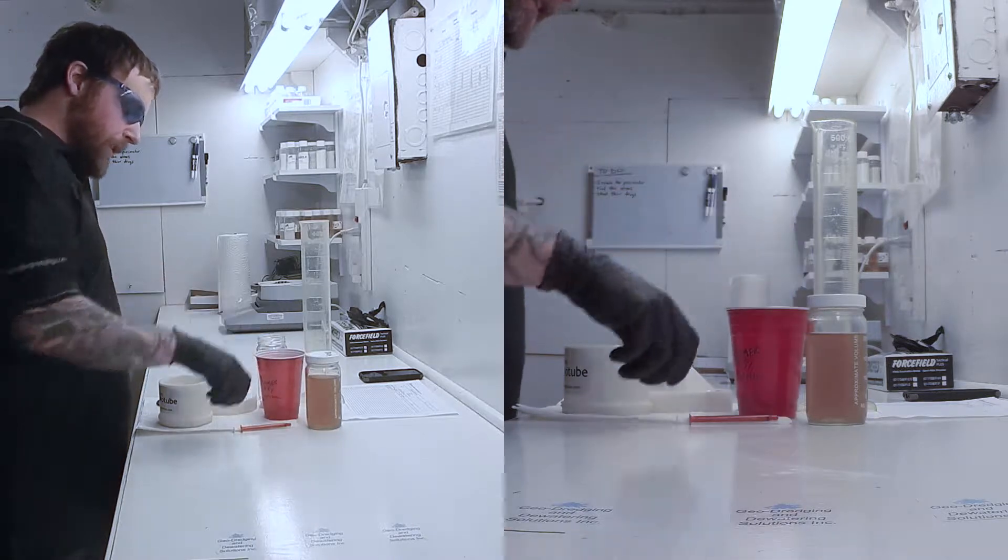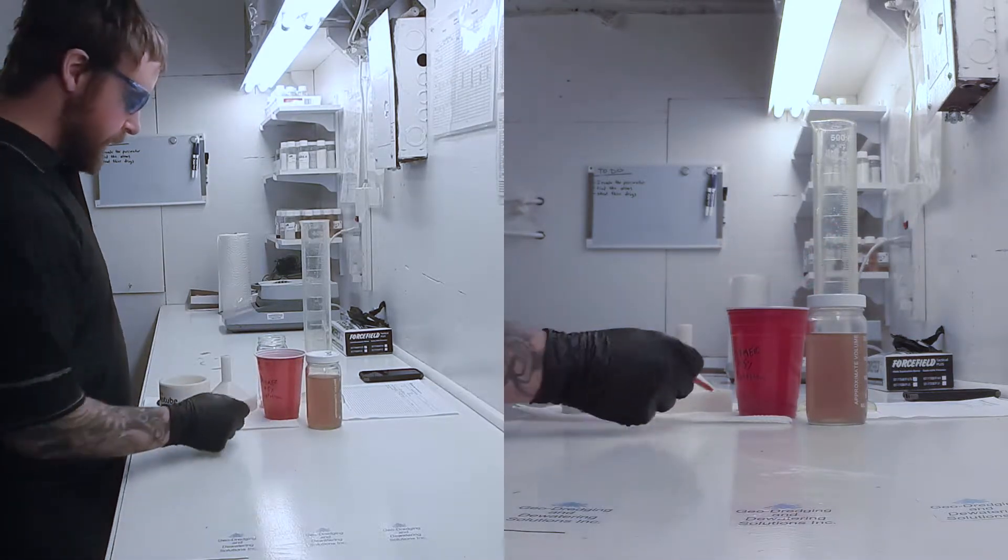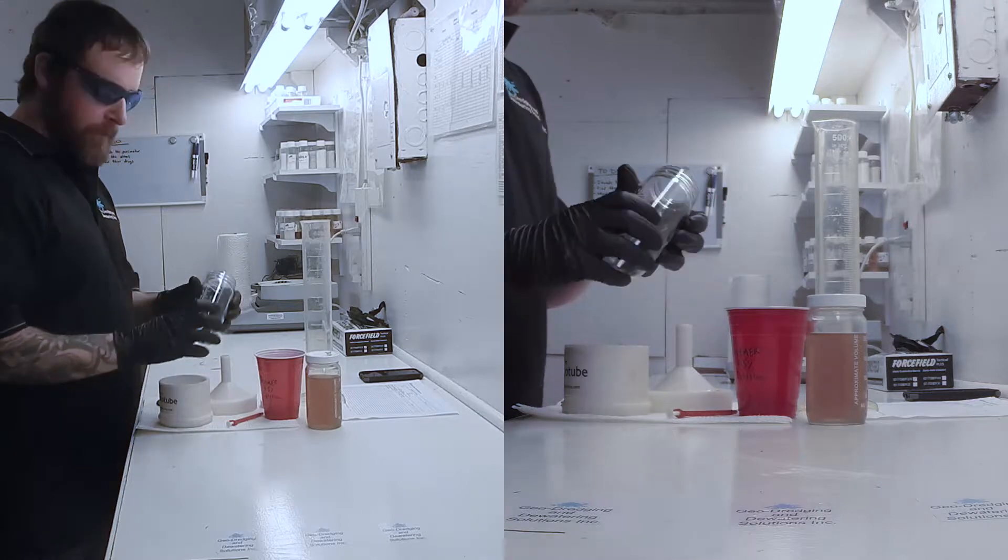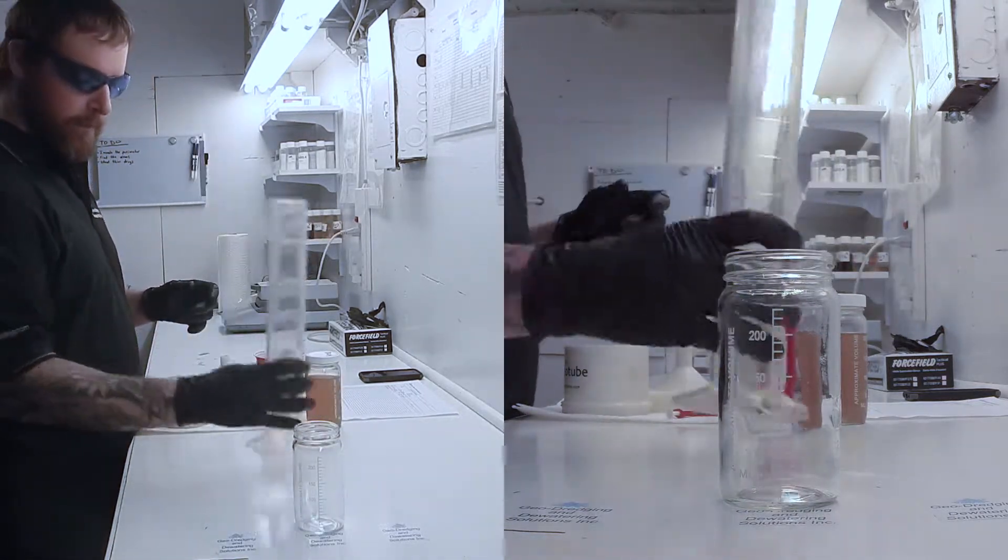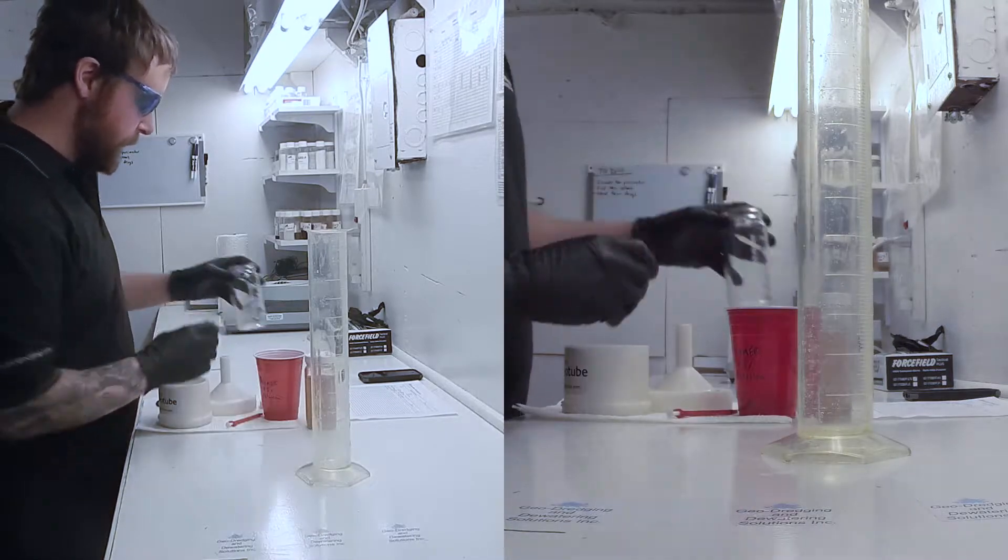In order to administer the polymer, you'll need a syringe, and to hold everything, a variety of graduated jars and graduated cylinders. Let's begin.